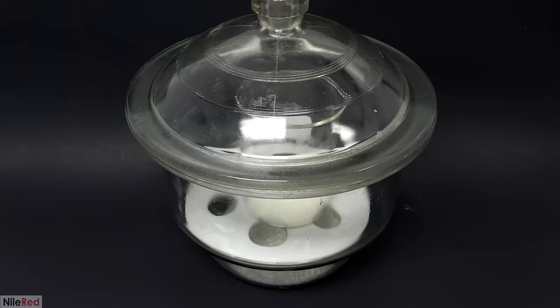Anyway, after adding both these chemicals, I then poured in 150 mils of dry ethanol. I let it stir for about 10 minutes, but not everything dissolved, so I moved on to adding the triethylamine. The moment it was added, it immediately turned yellow, and it also seemed to slowly clear up a bit. Just like the other reaction, to get it really going, I had to heat it, so I set it up for a reflux.